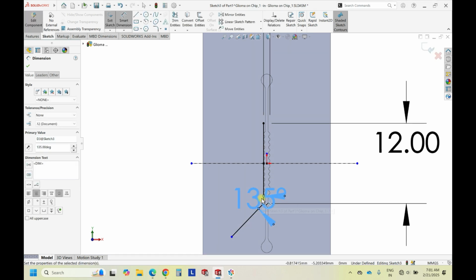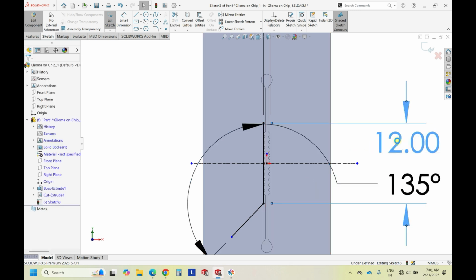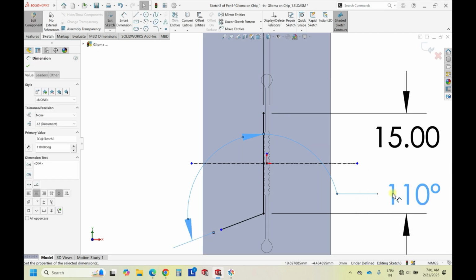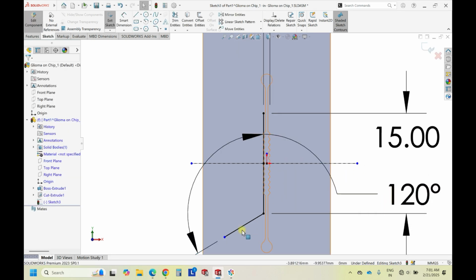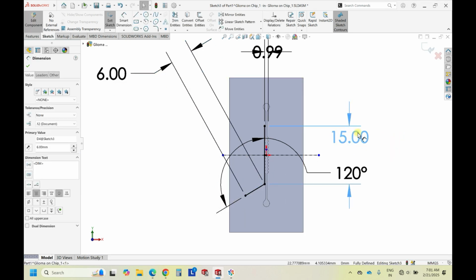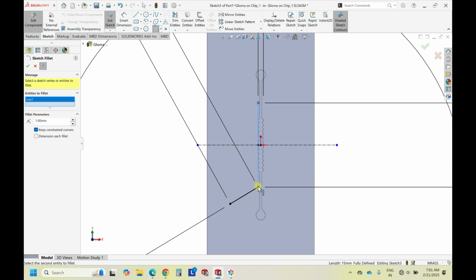Let's keep again this is 135 degrees. So you want to have a shape. This can be split. Choose the fillet over here. Fillet time.